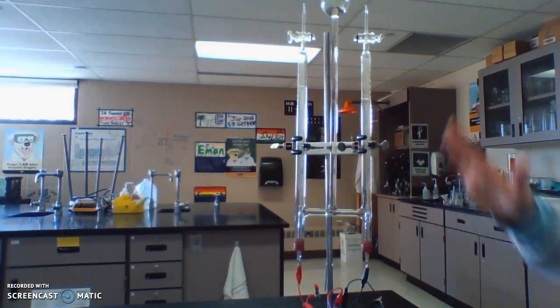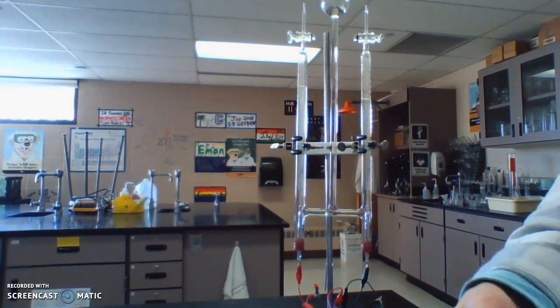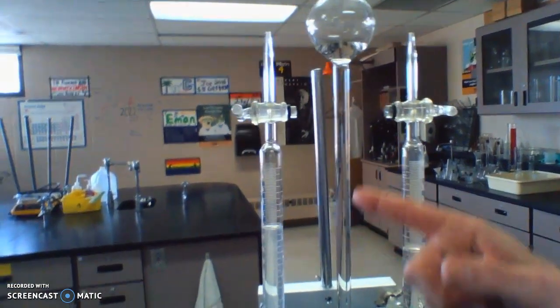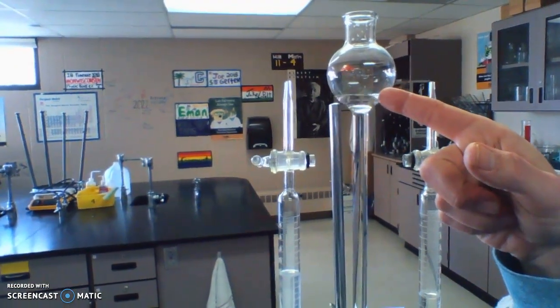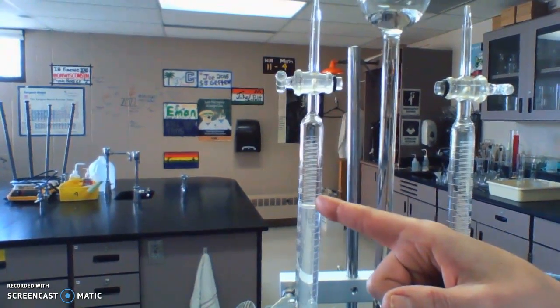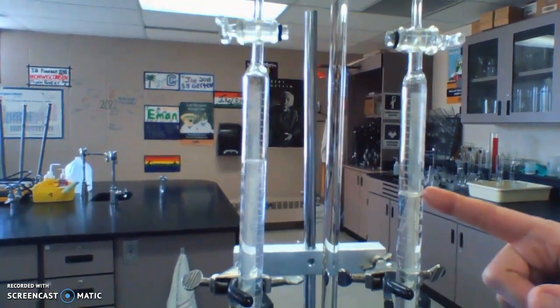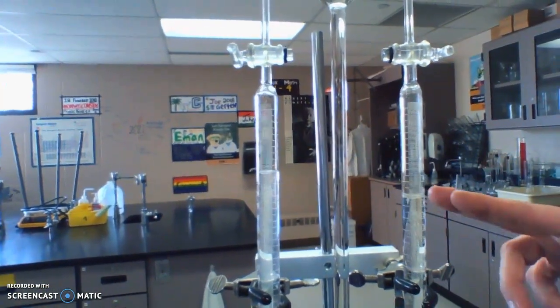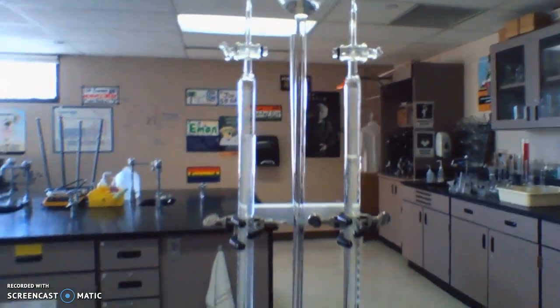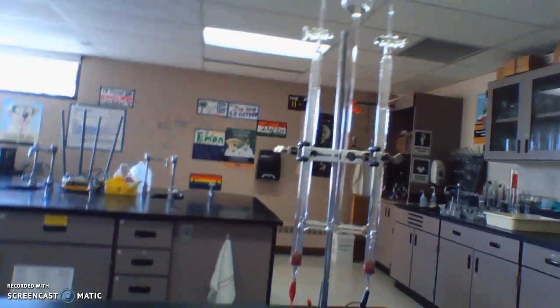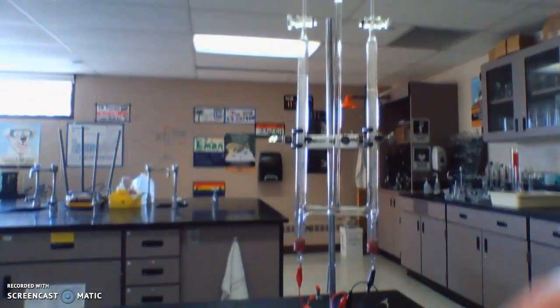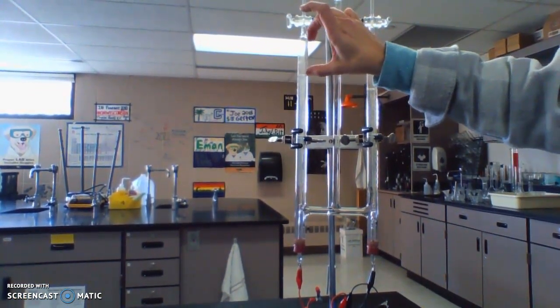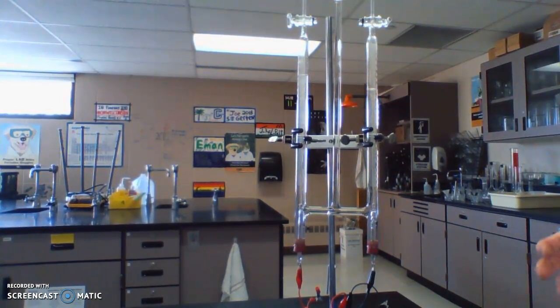Back to part B. This has been going for a while. The water level in the middle tube is all the way up here, and it's pushed down on one side and all the way down to here on the other side. You can see there's a different amount of gas in each tube because we have two different gases. Clearly we have more on this side versus less on this side.